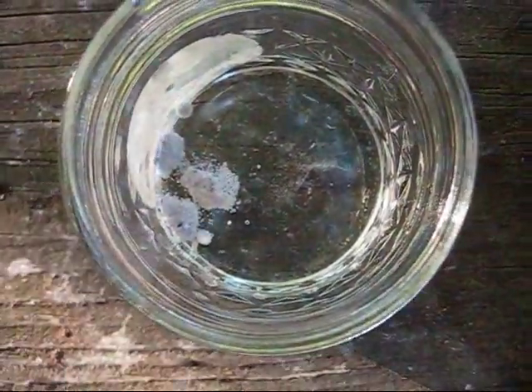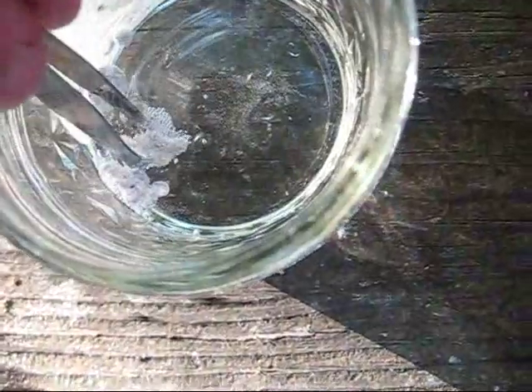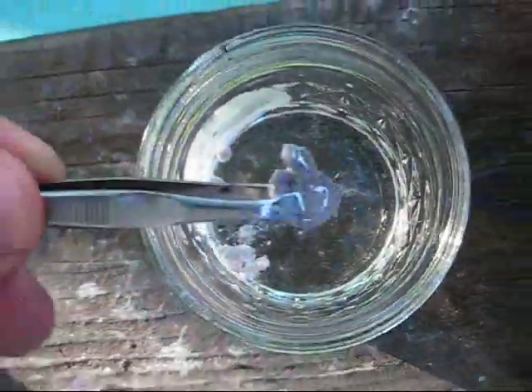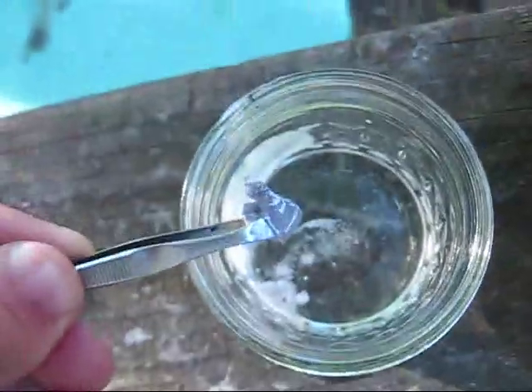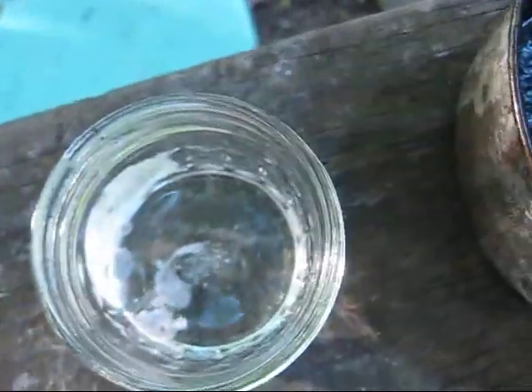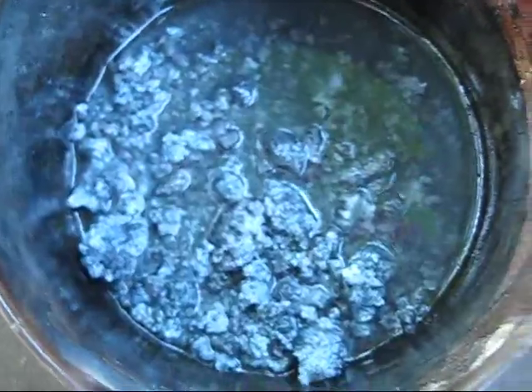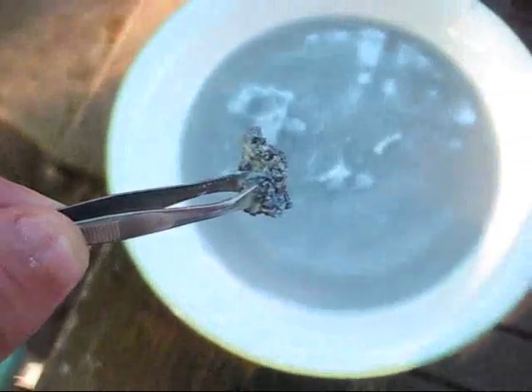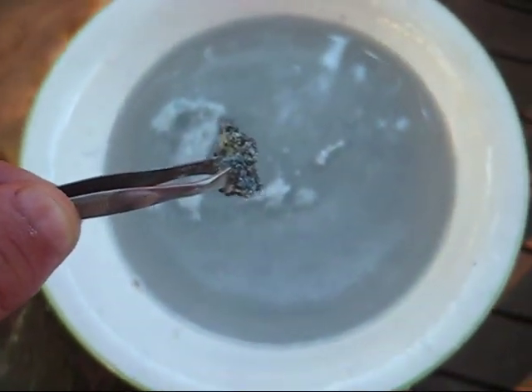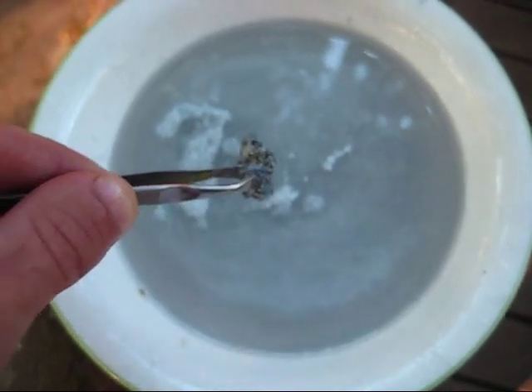So I have developed a way to remove large ingots of elemental sodium, as seen here — it's kind of a little salmon silvery color. I have developed a way to remove those ingots out of this raw material and it's going to sound a little bit nuts, but it's the best I've got. Put water in this bowl and then put a layer about a quarter inch thick of oil on top. A portion of the raw mix is taken and dropped into the bowl and it will begin to react.